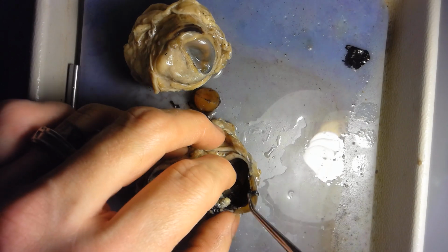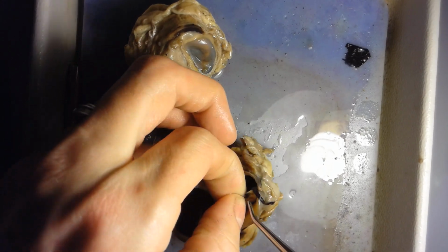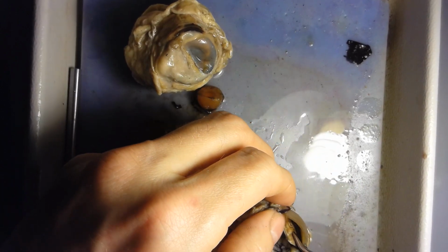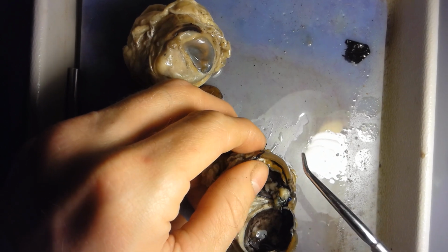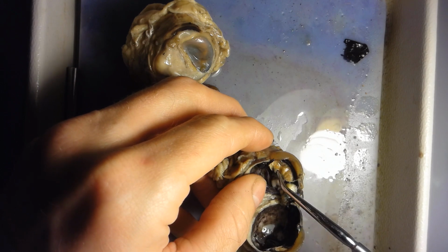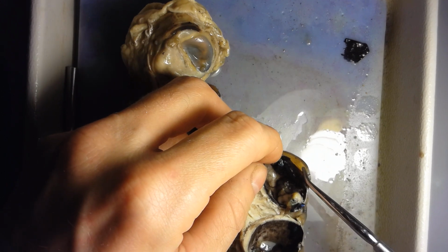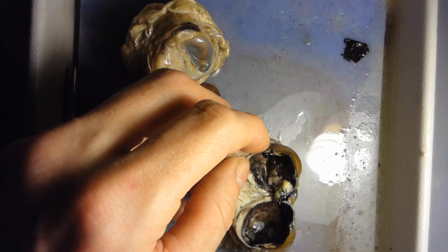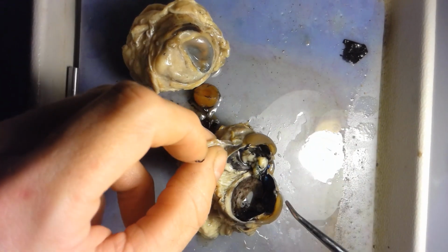Okay, the iris of the eye again is a colored region. So if I pull this back a little bit here, this colored region is the iris of the eye right there. This is again the cornea that I'm pulling away here. The pupil is a hole, which you can't see that well because I cut it right at the pupil, but it's an actual hole. Vitreous humor we talked about is that thick, gel-like fluid right here.